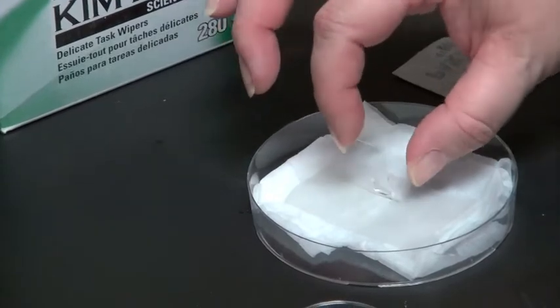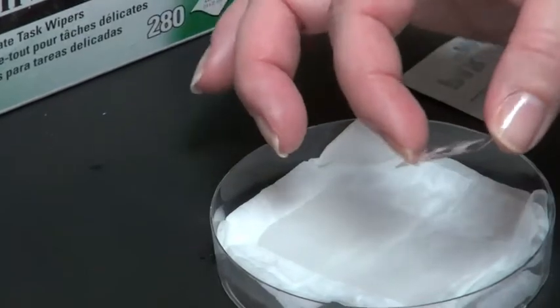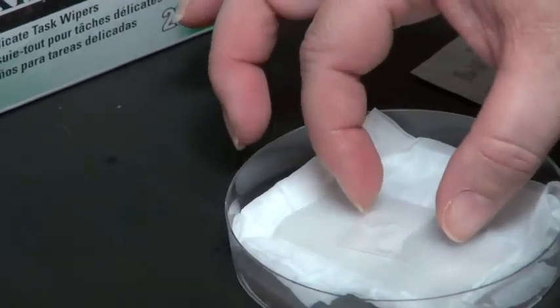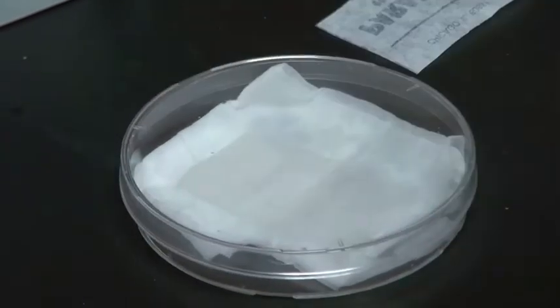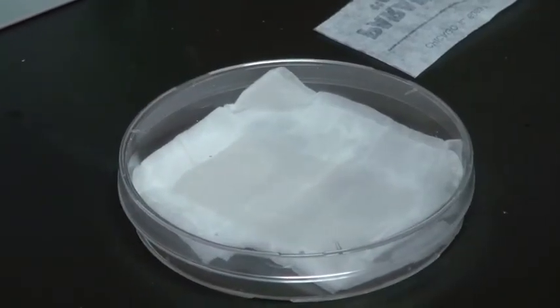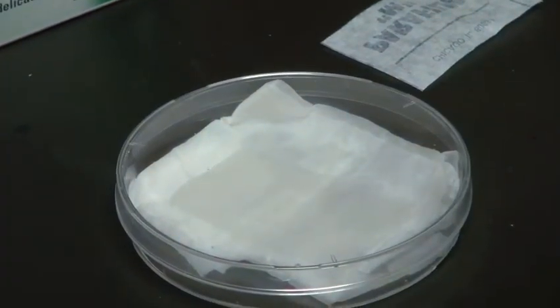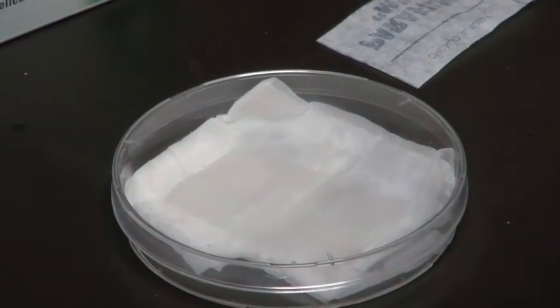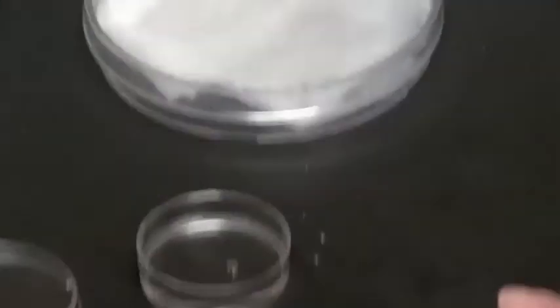Make sure that you spread this a little to cover your cells, and now you're going to put the top onto your humid chamber. Your antibody or staining reagent will not dry out and you don't have to use as much — I used about 40 microliters here, as opposed to maybe a milliliter inside of a chamber like this.